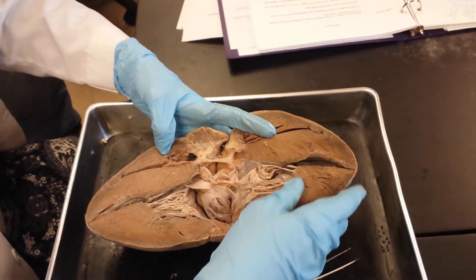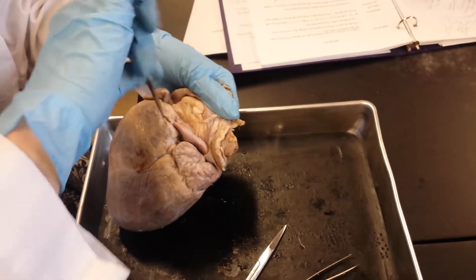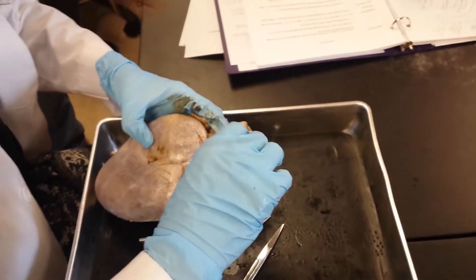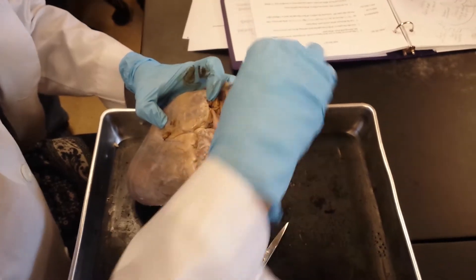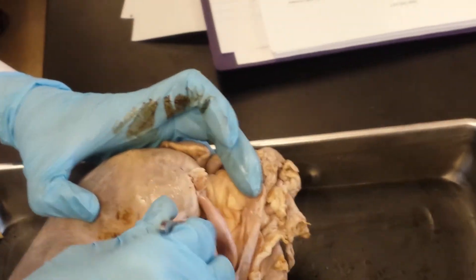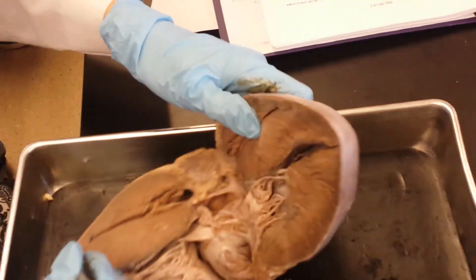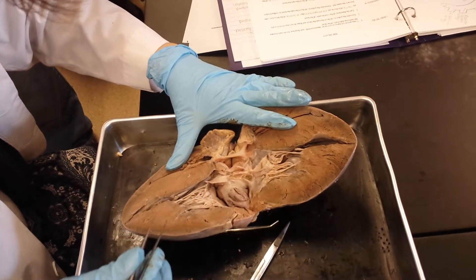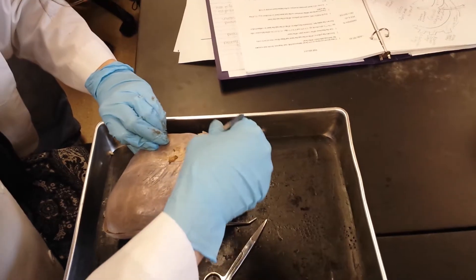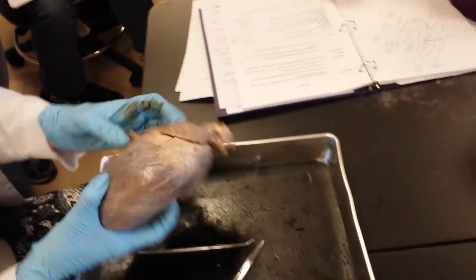How do I find the pulmonary semilunar valve? It's on the outside. We did a little cut here on the outside and then lifted it up — and that is actually the pulmonary semilunar valve right there. The best thing to do is cut the heart right at the base of the pulmonary trunk, and that's where your pulmonary semilunar valve is.